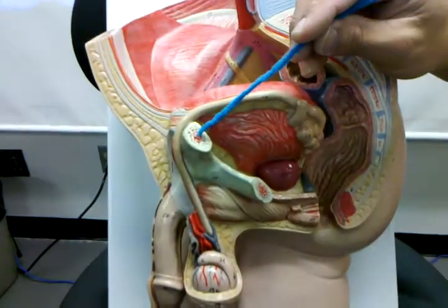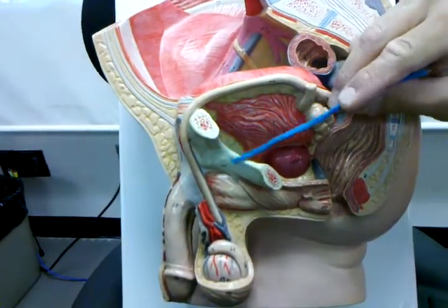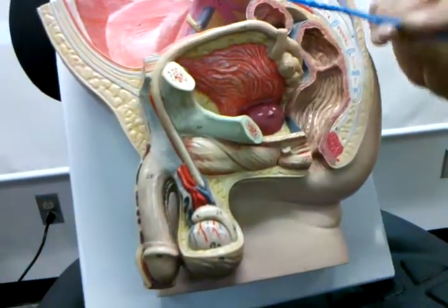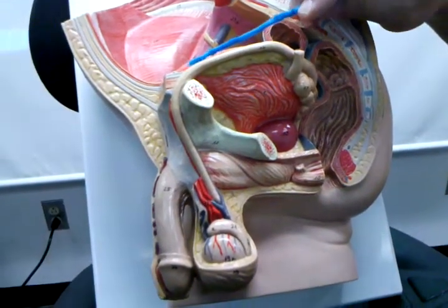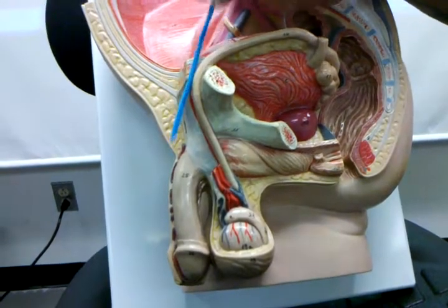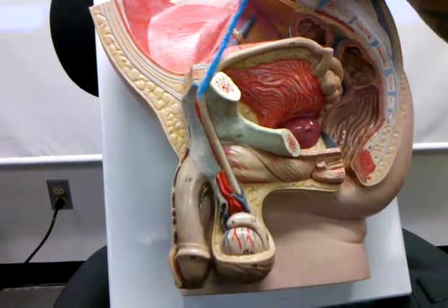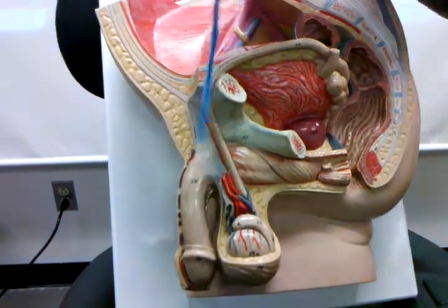Here we have bone. So this bone right here is pubis, this bone right here is ischium, this is the obturator foramen right here. And if we go over the pubis, what we're going to see is male reproductive structures associated with the testis, which are running over the top of the pubis and passing from inside of the body cavity to outside. So they go from inside the body wall to outside of the body wall.